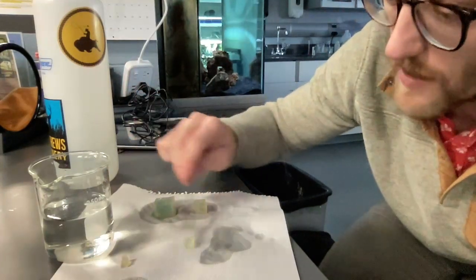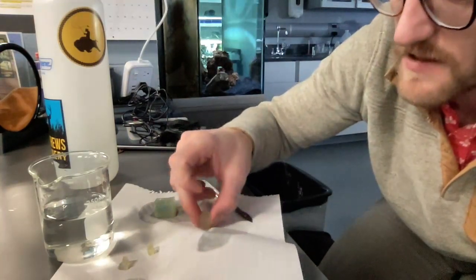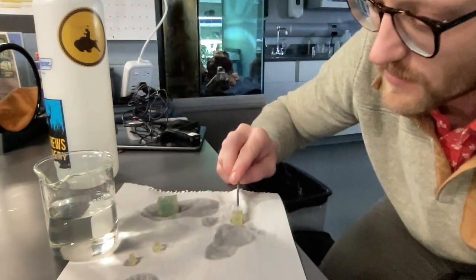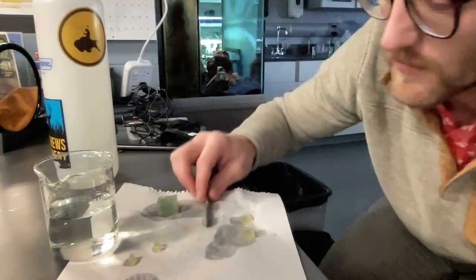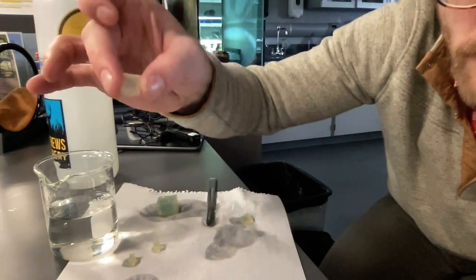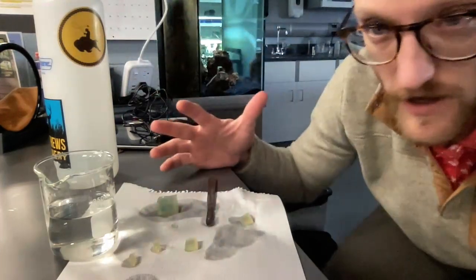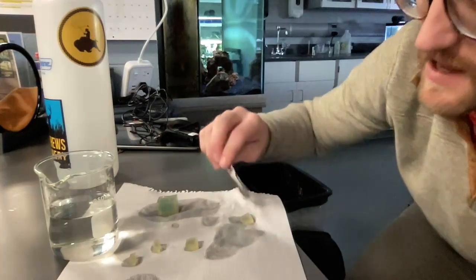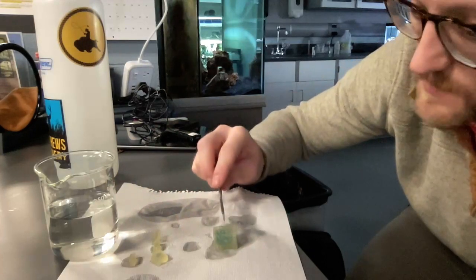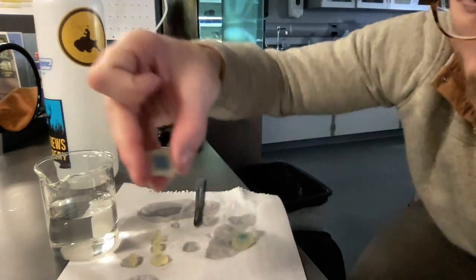Now, when we go to our other two cells, if we look closely at this one, there's a small blue portion in there. When we cut that open and look, we can tell it was close, but that little bit of blue shows that the vinegar didn't make it all the way through the cell. That tells us the cell would not have gotten all the nutrients it needs. Finally, our largest cell: we can definitely see some color in there, and when we cut that open, very satisfying. Look at that. We see that dark blue.